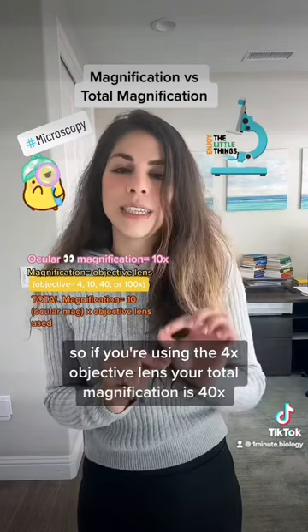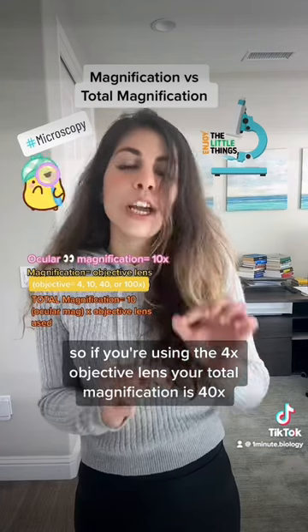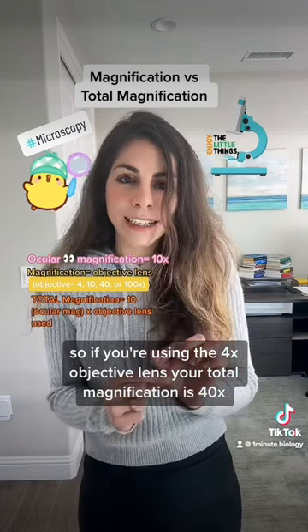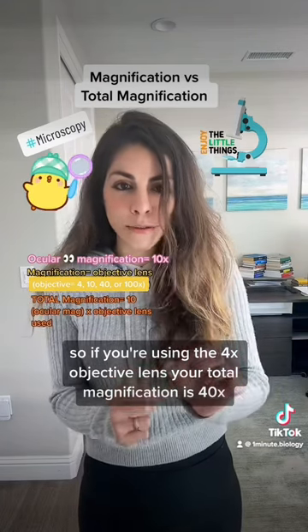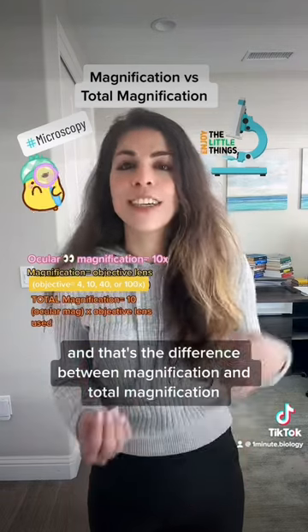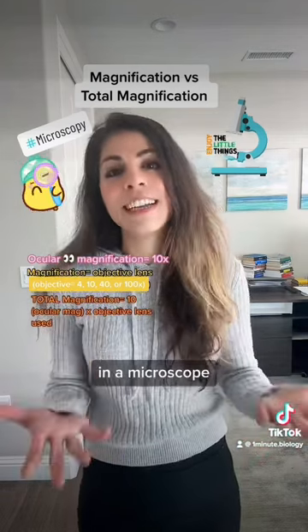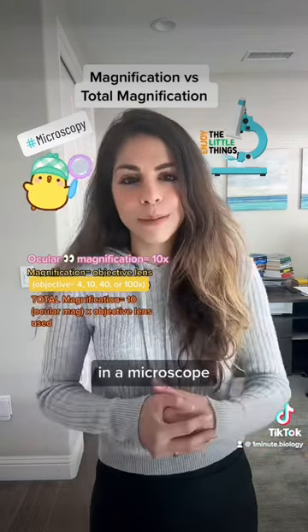So if you're using the 4x objective lens, your total magnification is 40x. That's the difference between magnification and total magnification in a microscope.